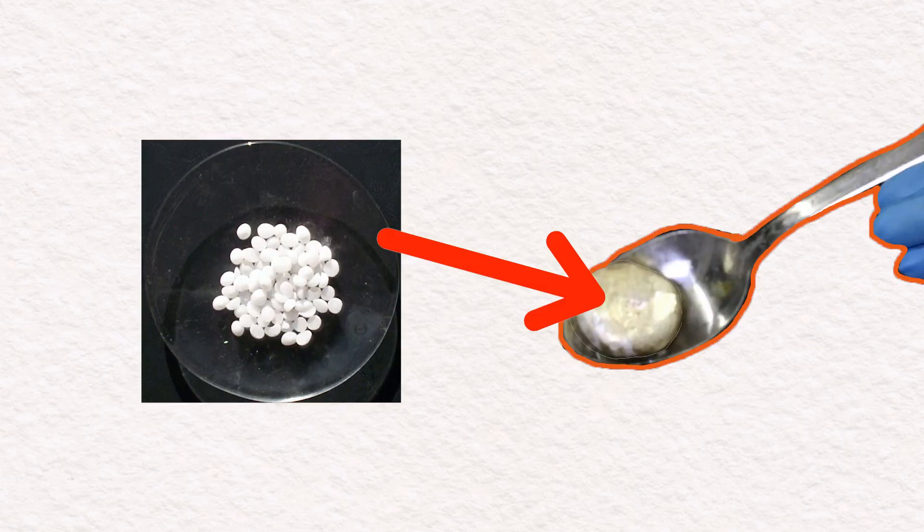In this video I will be making sodium metal with sodium hydroxide. Right now I don't have too much use for sodium metal but it's just a very fun element.